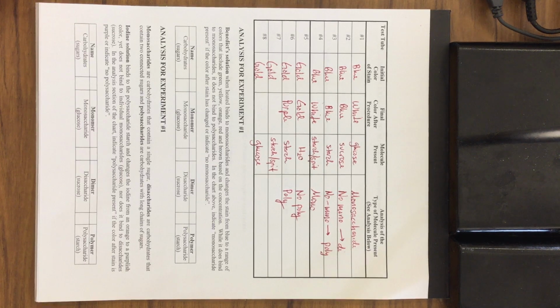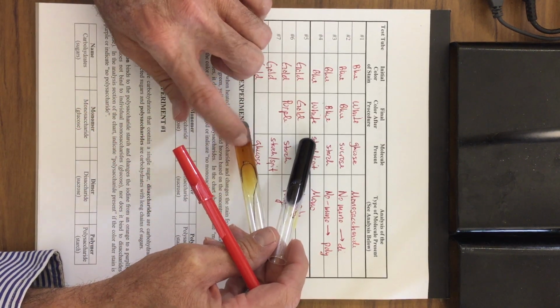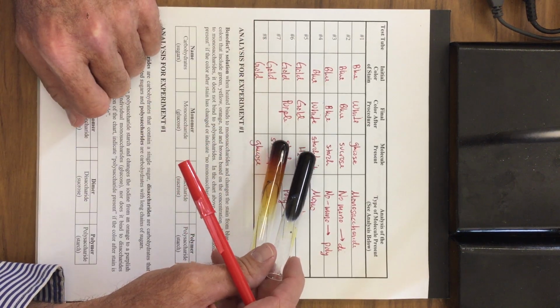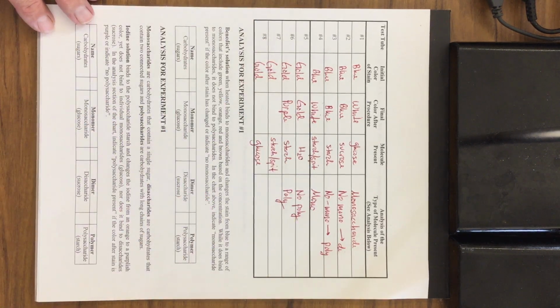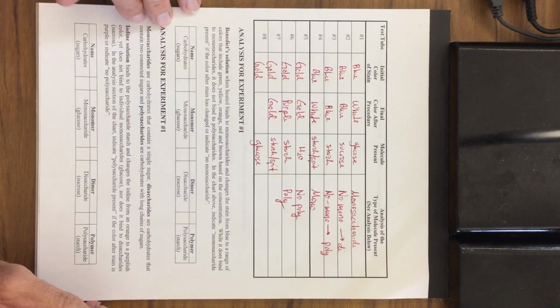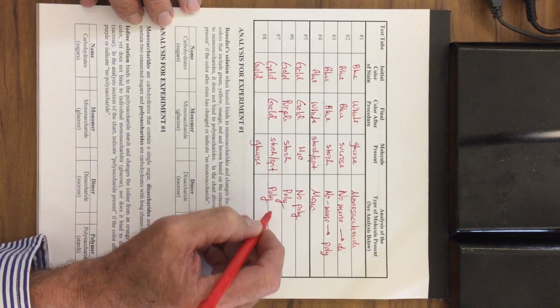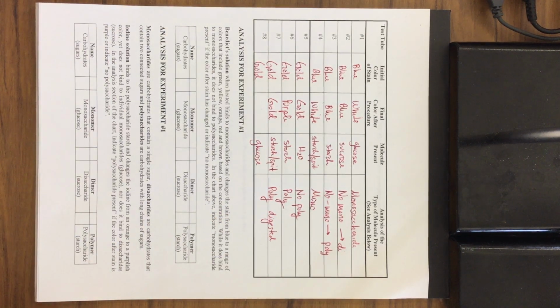So there are those two. And then number 7. Here's number 6 with the starch. Here's number 7 with the starch, but this is the one that we also added the spit to. You can see that there might be a tiny bit of starch left, but most of it's gone, and we're left with monosaccharides in there. So this stayed gold. And the reason why? Well, it started off as a polysaccharide, but the polysaccharide was digested. That's what your enzymes do. They digest things into smaller things.